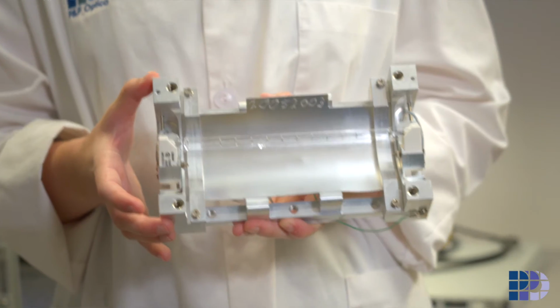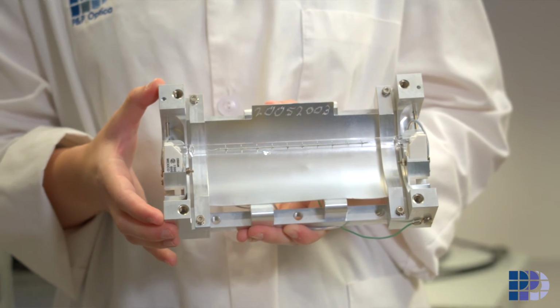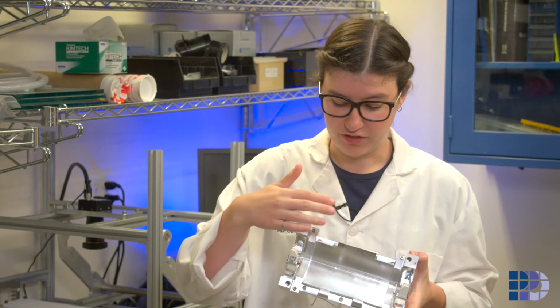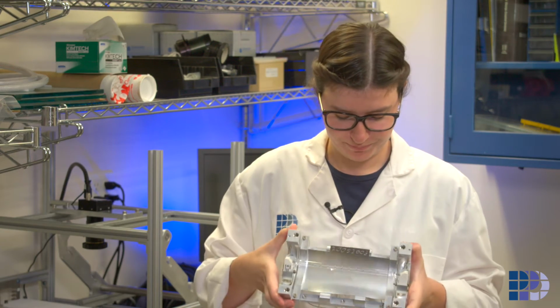PPO designs and builds halogen lamps in-house. They are specially designed to be interchangeable, easy to maintain, as well as repair. Multiple design features have been selected to ensure that the lamps are easy to align while minimizing the risk of the lamps becoming misaligned over time. So here I'm holding a partial lamp assembly where you can see the lamp internals. It's just missing the front cover and the back cover.